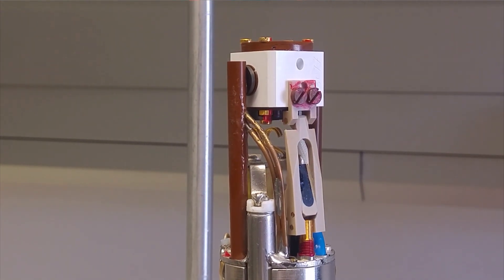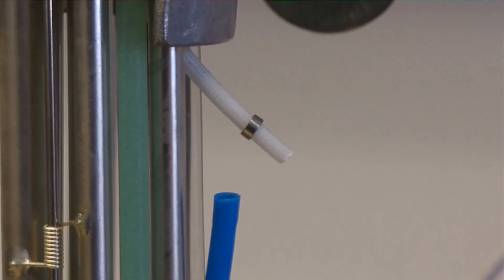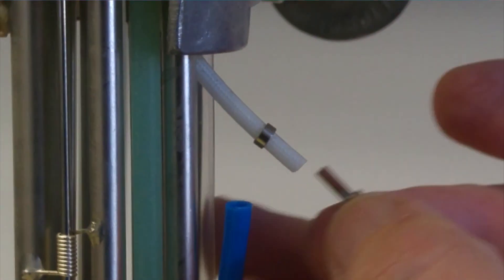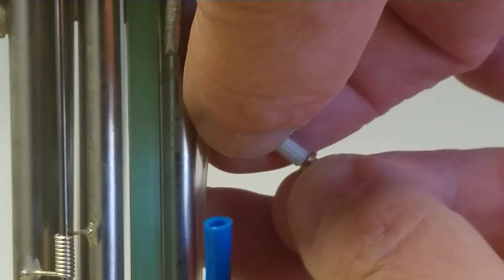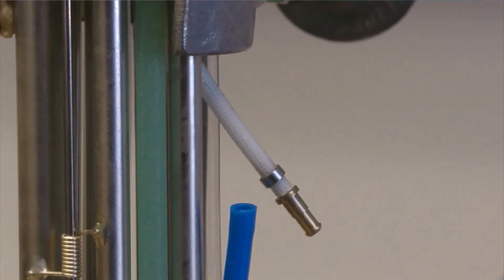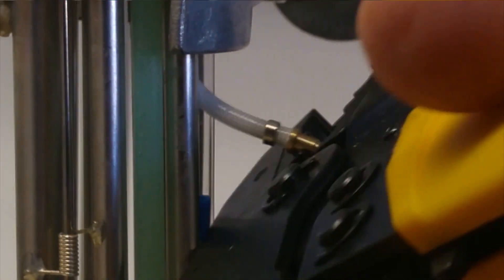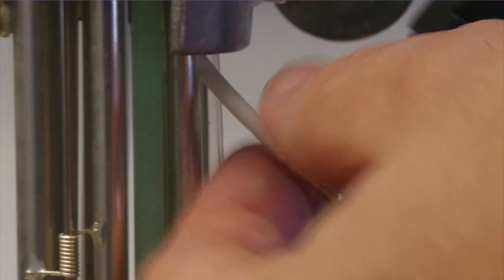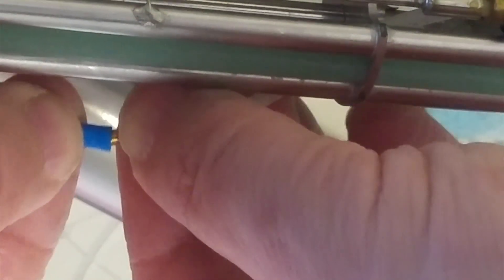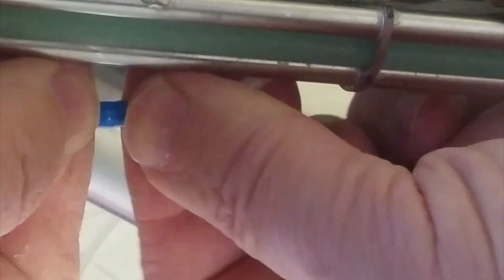So that's it. We've got the magic angle working. So, what we have to do here is put this on here, having cut it to length, and crimp it so it can't go anywhere. I hope I've got the right tool here. Let's give it a shot, see what happens.